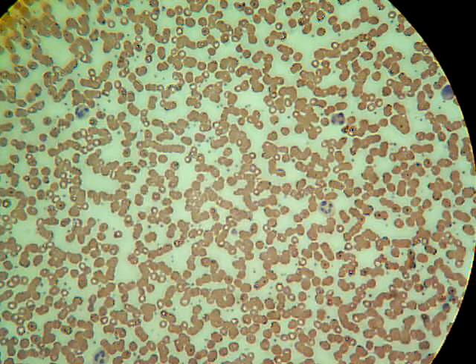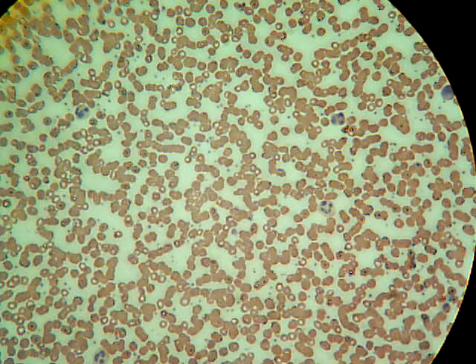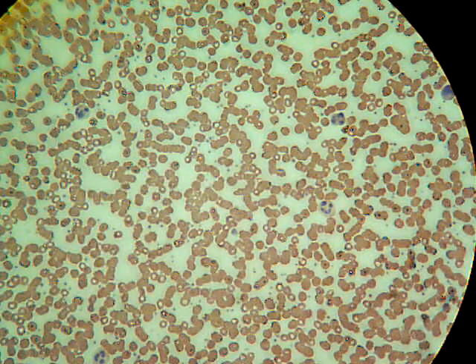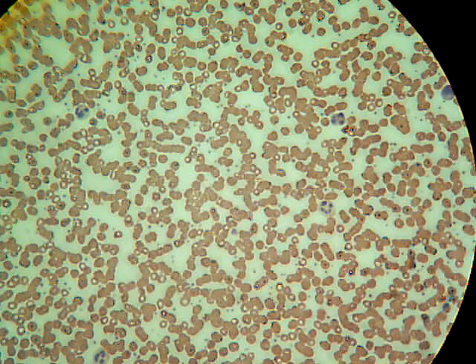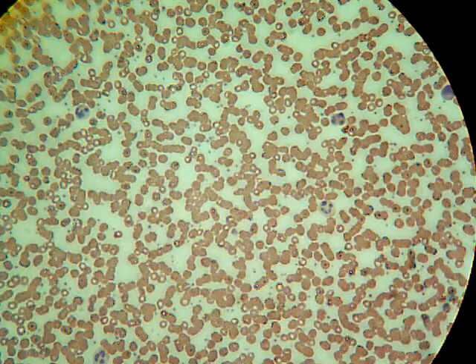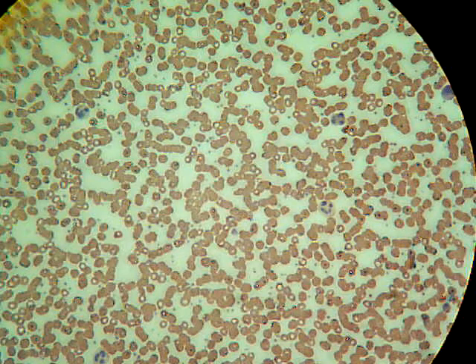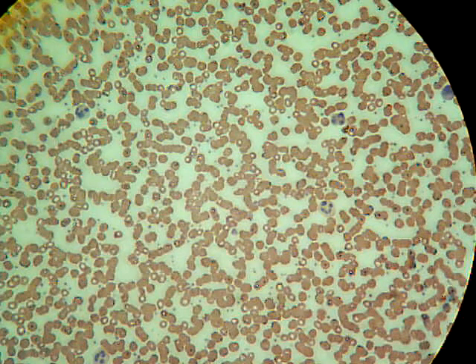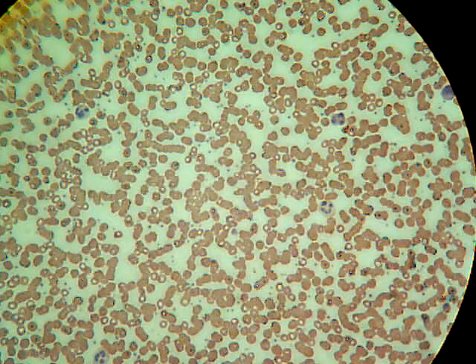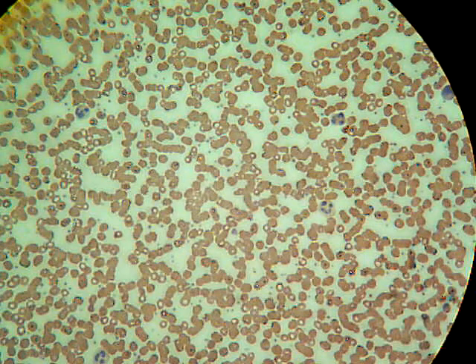This slide is at 400 times magnification, and it is a view of blood. The majority of the cells that you're seeing here are red blood cells, and you can see a few that are stained darker purple, and these are the white blood cells.